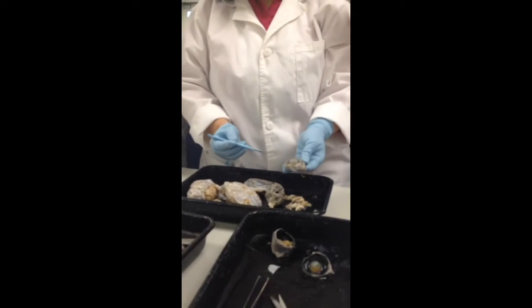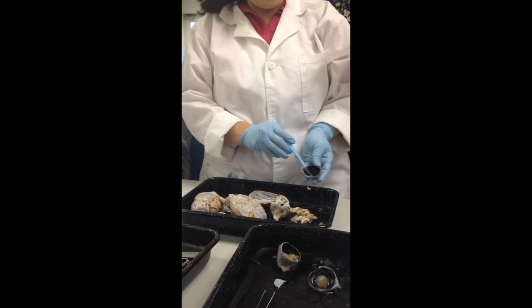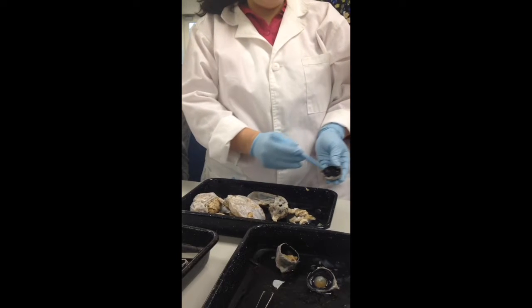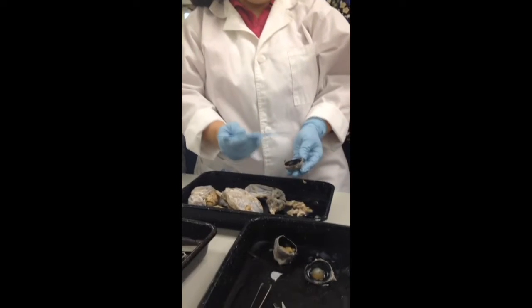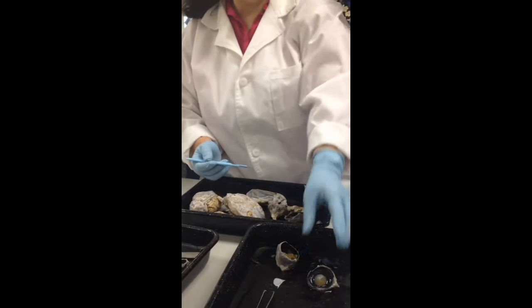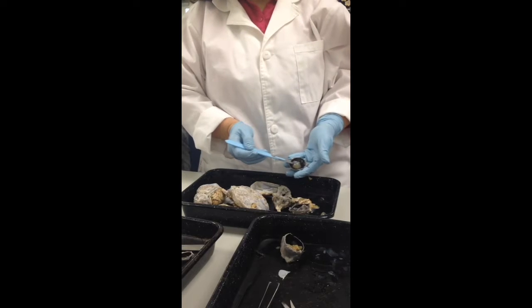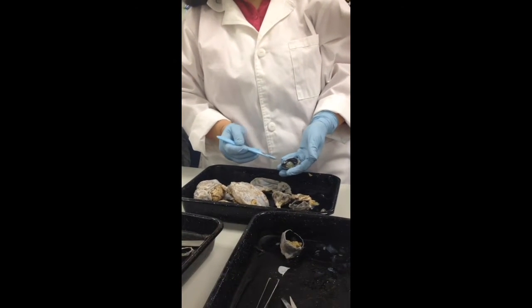Okay, so on the front of the eye, light crosses through that hole. What is that hole? The pupil. And the pupil changes size based on this structure, the iris. Okay. Now directly on top of that, you would have this, which is the lens. And the lens is attached by the ciliary body and the ligaments.